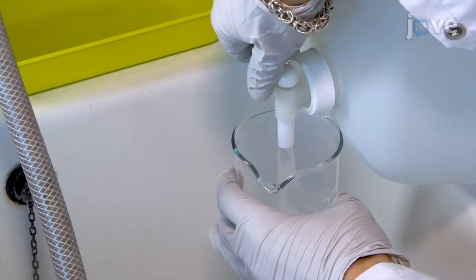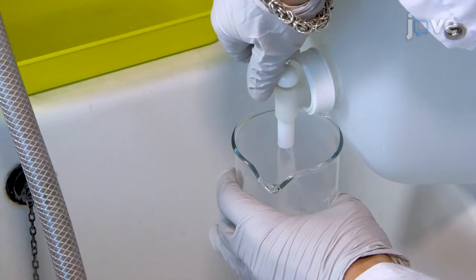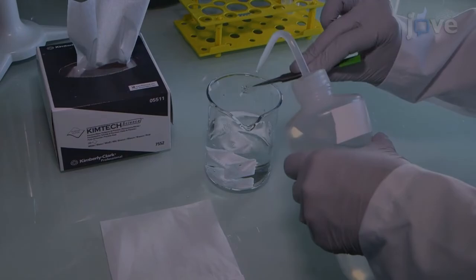After three minutes of incubation in siliconizing reagent, transfer the cover slip holder with the cover slips to the beaker with water. Thoroughly rinse the cover slips with ultra-pure water.